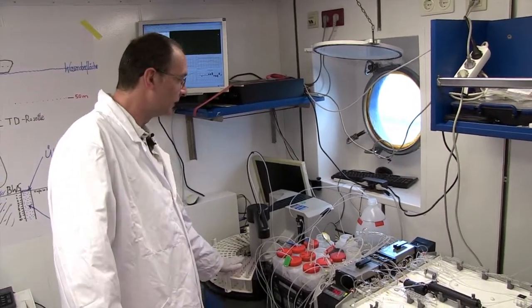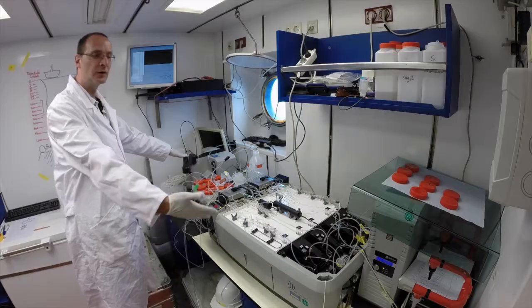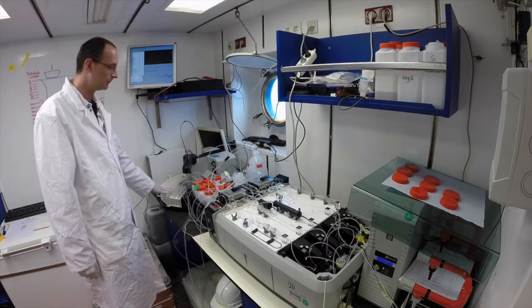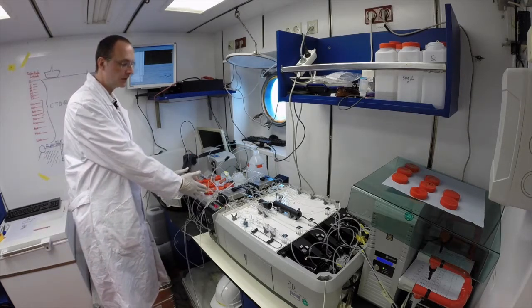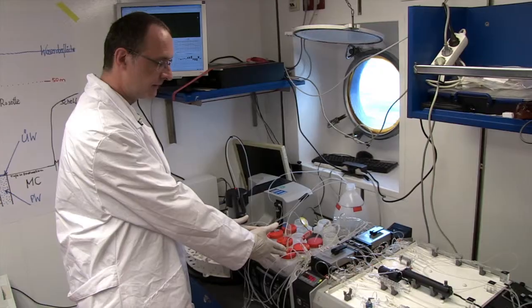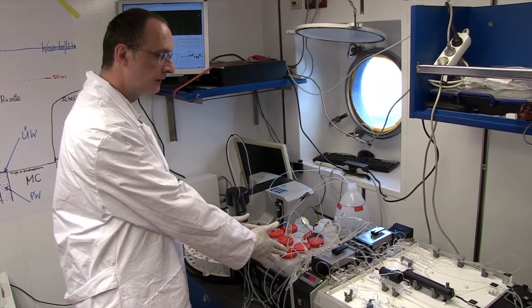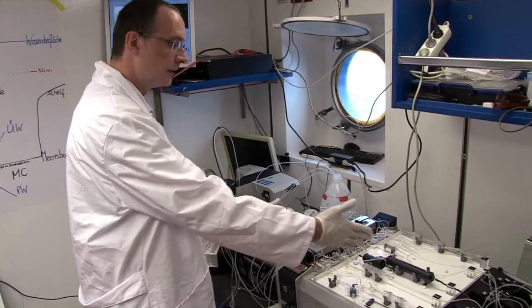Now I'm in the laboratory with all my samples, which I transfer into the sample injector on the auto-analyzer. For each individual nutrient to be analyzed, we need reagents. These reagents are mixed with the sample in the system.